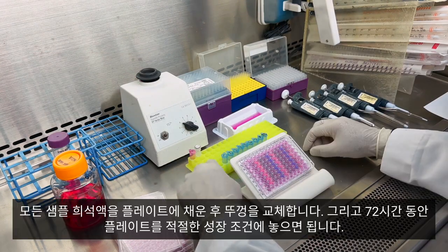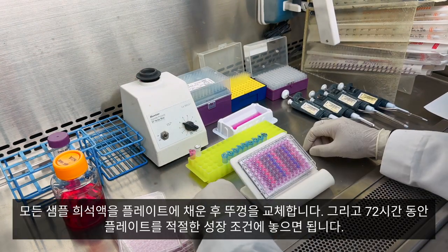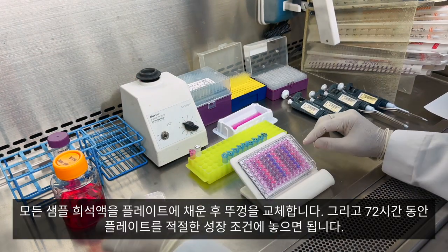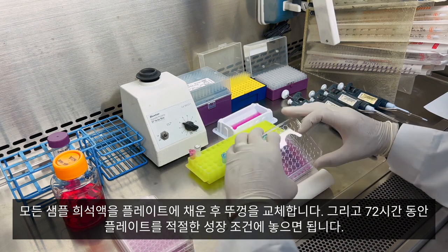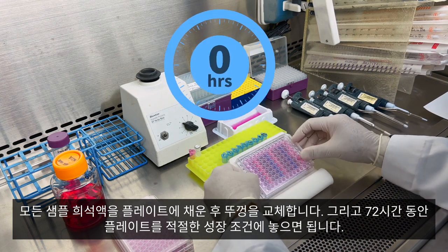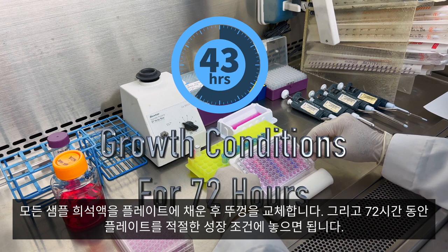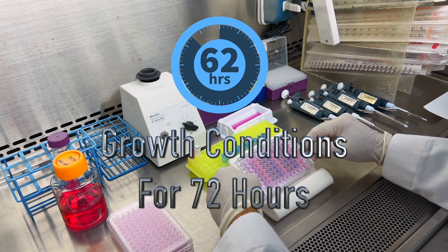Once you've completed adding all your sample dilutions to the plate, replace the lid. You'll want to transfer your plate into the appropriate growth conditions for 72 hours.